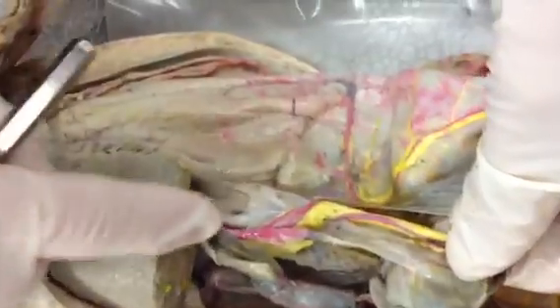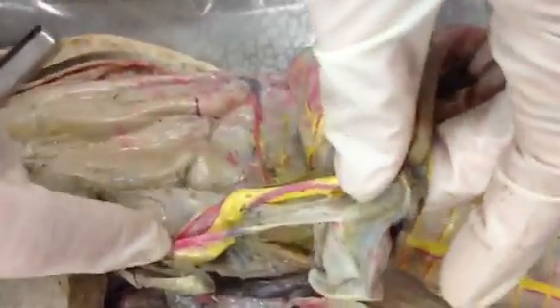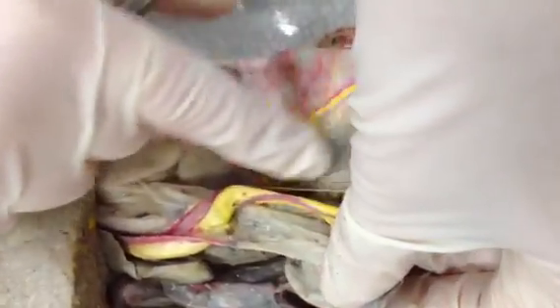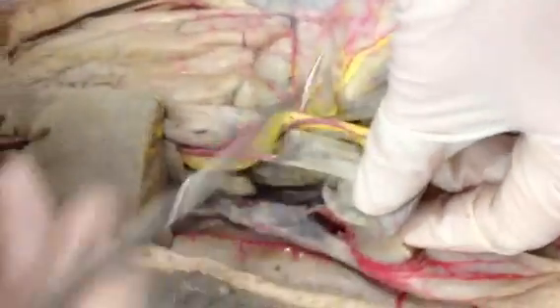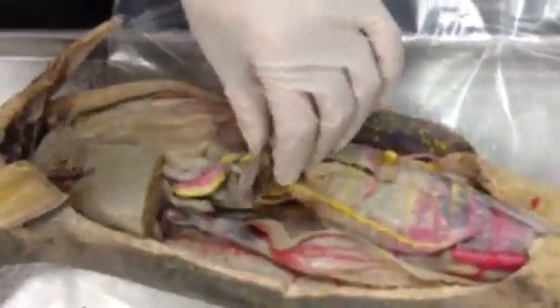For the hepatoduodenal ligament, it goes from the liver to the curvature of the stomach — sorry, that's actually the hepatogastric. The hepatoduodenal goes to the more cranial part of the intestines, where you would think the duodenum would be. So this is hepatoduodenal, and this is hepatogastric. Remember on the slideshow those two are mixed up.